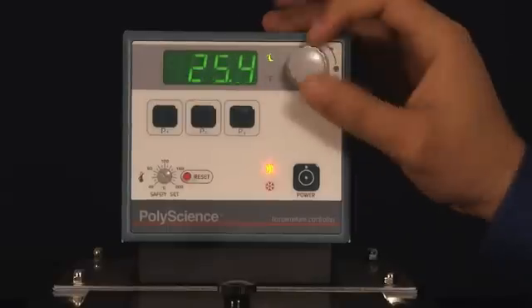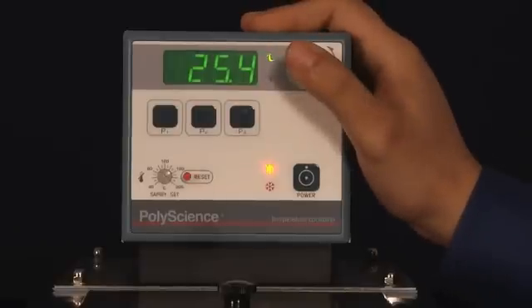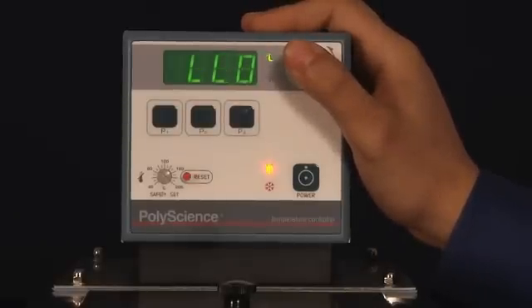At this point, no changes can be made to the screen at all. To remove this feature, simply press and hold the select set knob again until the screen reads CAN, which stands for Cancel. Again, this will take approximately 10 seconds.